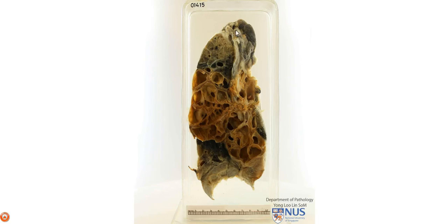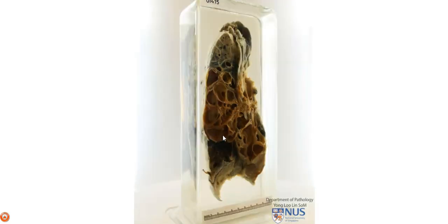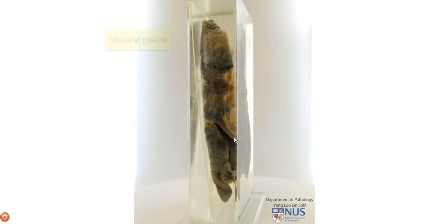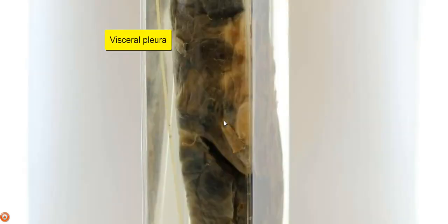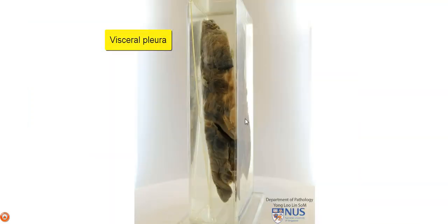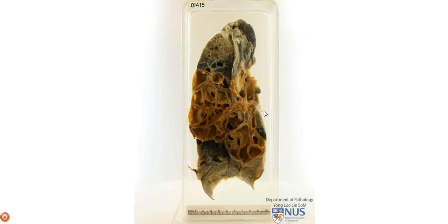Here is a slice of lung, and when I rotate, you can see that this is the pleural surface, and I'm just going to rotate it back.